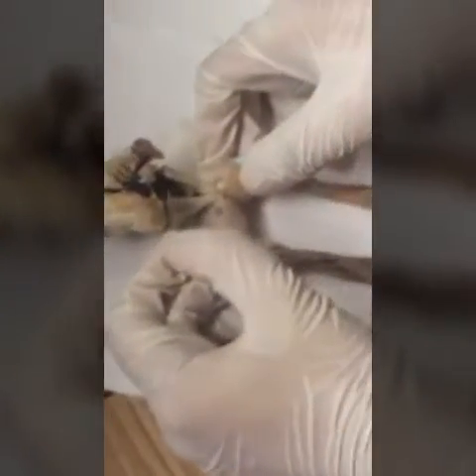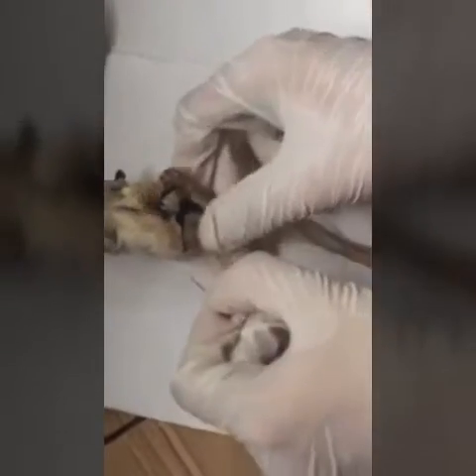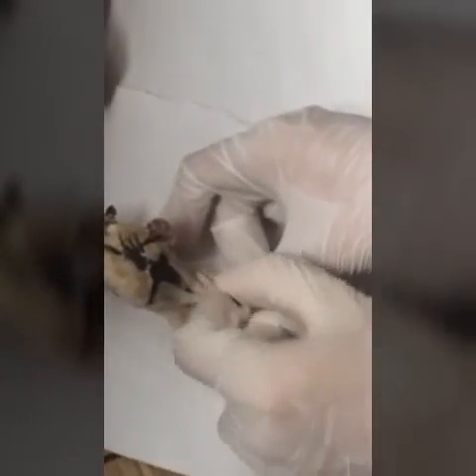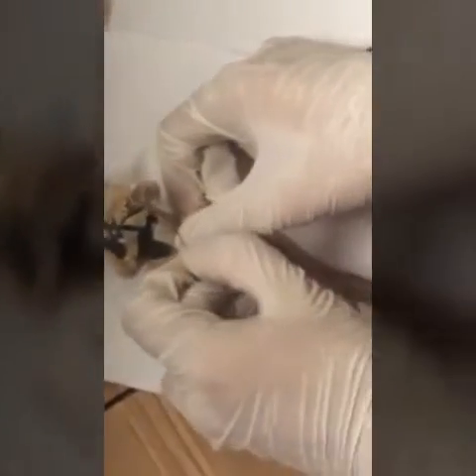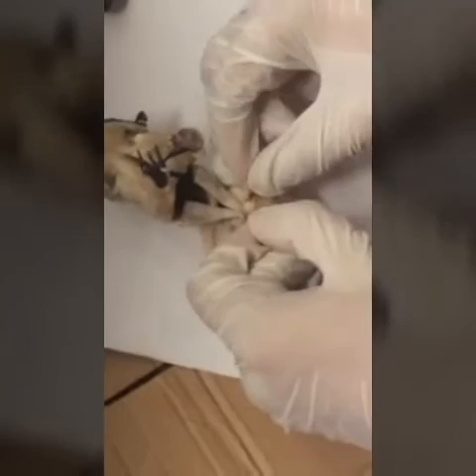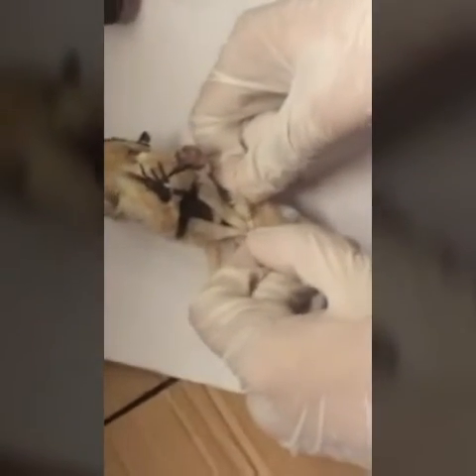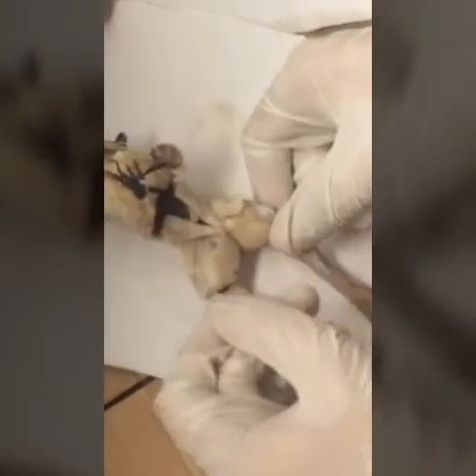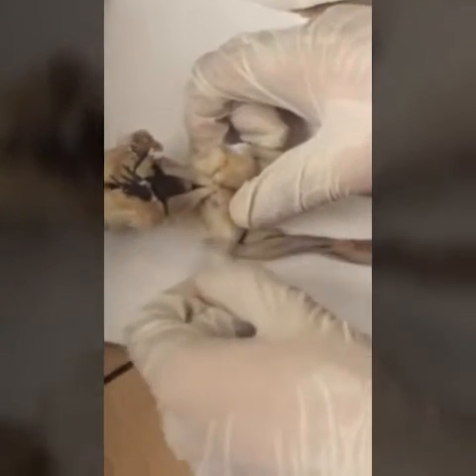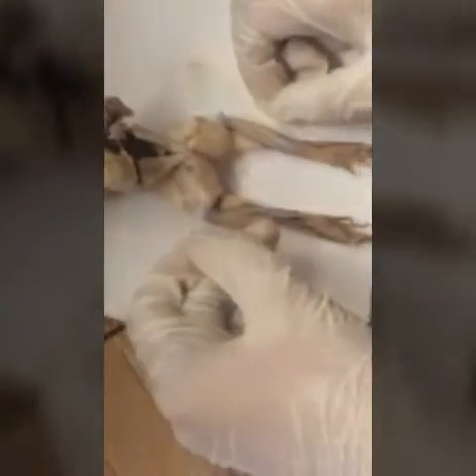This is the external oblique, one over here and here — they're both at the other sides of it. Then this is the transversus, a small square-like structure located here. Then we have the sartorius muscle, which is this cut region over here. This is the triceps femoris right over here — it's called triceps because it is apparently like three muscles.